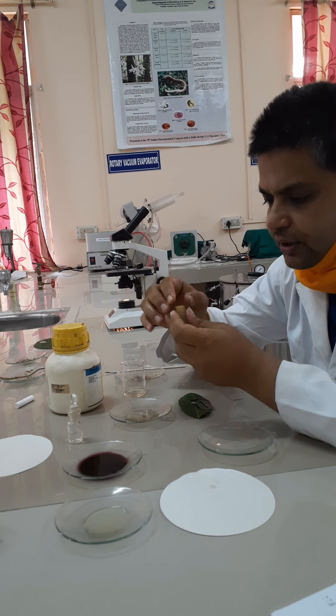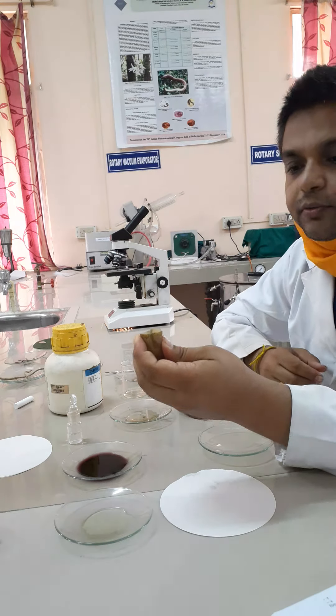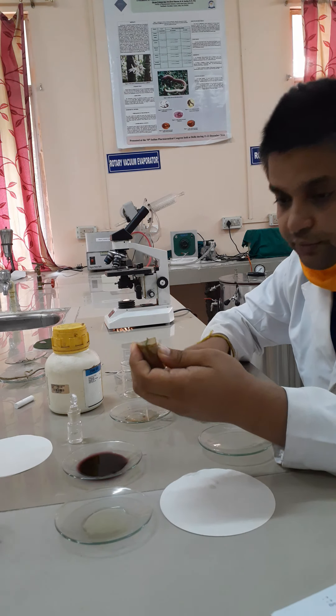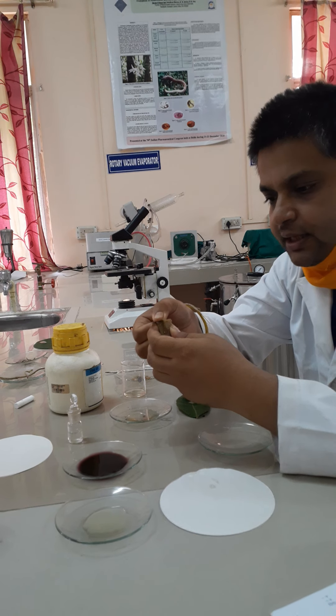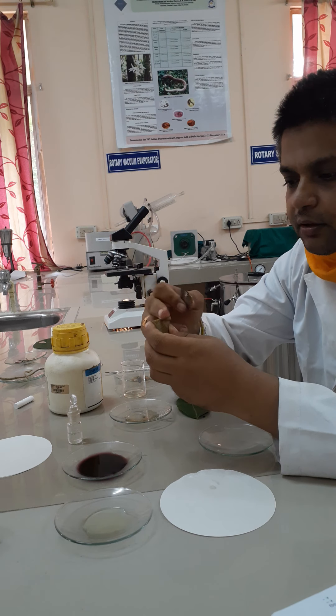In that fashion, you can see we are sandwiching the leaf in between two pieces of potato. That is why it is known as the sandwiching technique. Now, with the help of the edge of the blade, cut the upper part.